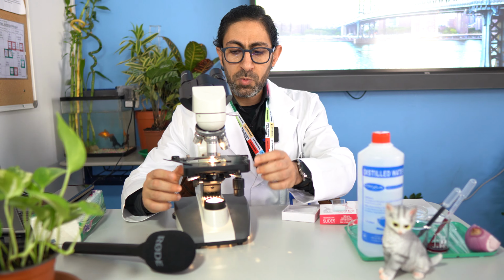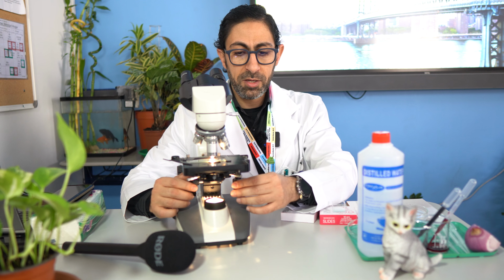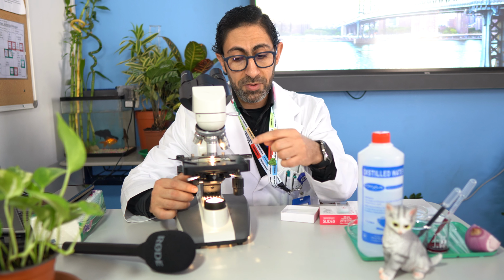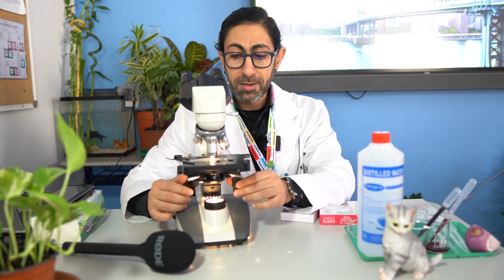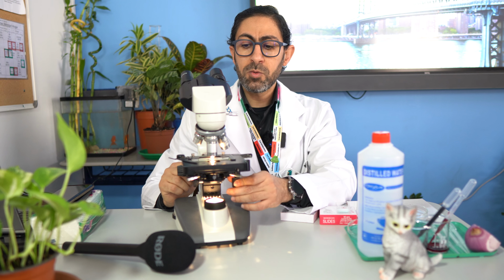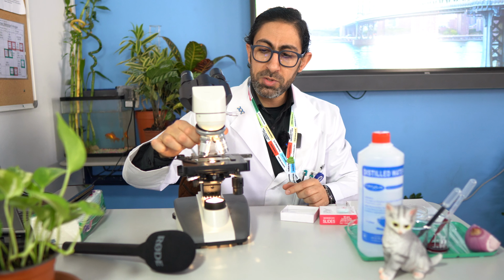And on the stage we have movement structures that allow the stage to move forward and backward, and even allow the specimen to move to the left and to the right in order to adjust the proper scene in which we will examine our specimen. Afterward, we have a nose piece. This is called the nose piece.